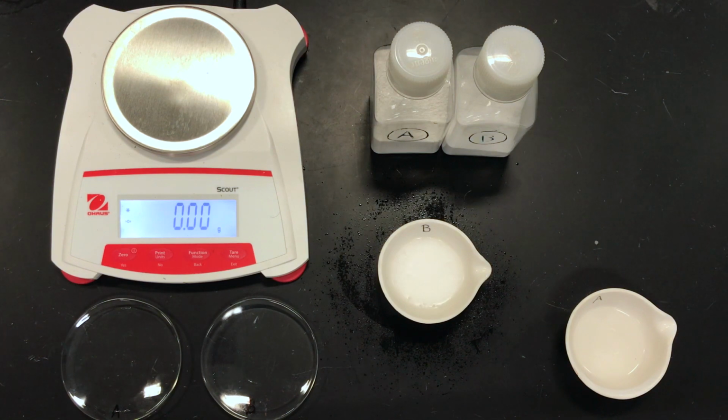And I'm just going to keep adding the hydrochloric acid. And certainly 1 molar could be used, but you're going to use a little more volume here. Again, that fizzing is decomposition of the carbonate ion, becoming CO2 and water. And you know that you've driven the reaction to completion when the fizzing is stopped, and you can clearly see no more visible solids.